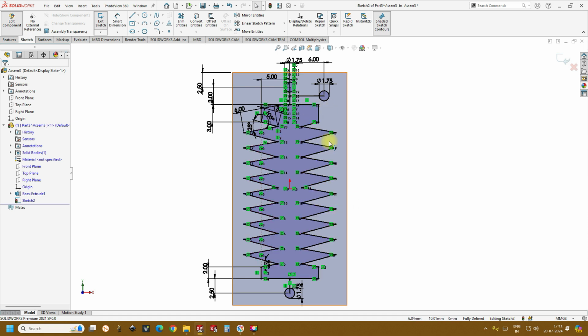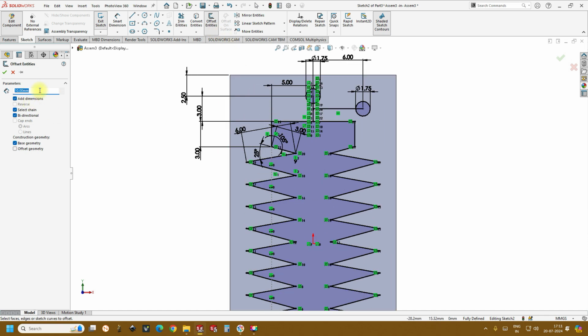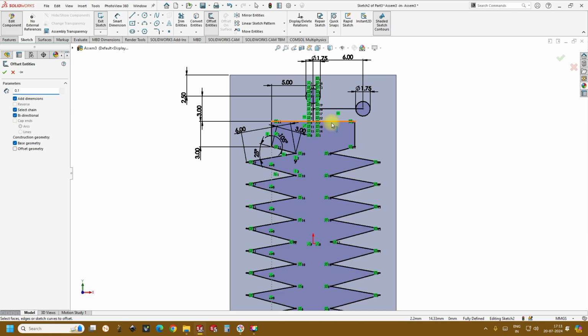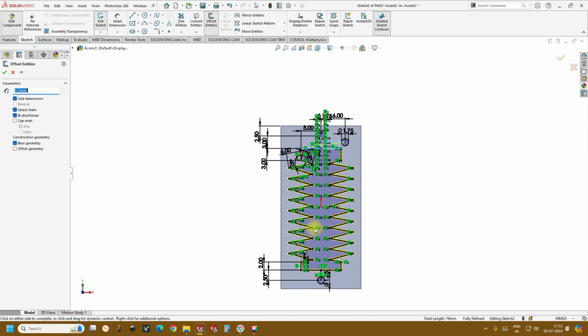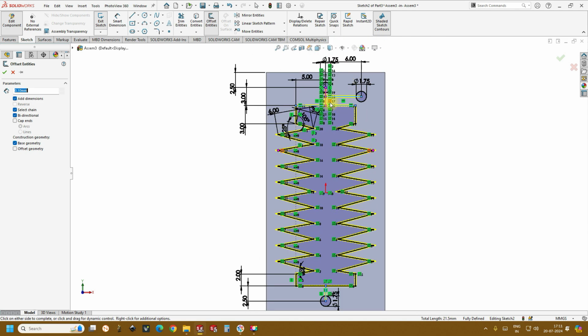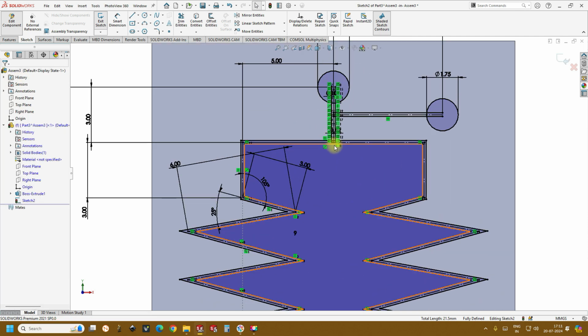And now since we have to create a channel, let's create an offset entity, and for the channel we'll keep it as 200 micron. Then it should be 0.1, and then it should be bidirectional 0.1. So 0.1 in two sides is 0.2 mm, so it will be 200 microns. So this is how it looks. Okay, and once you click OK, then you will see this.